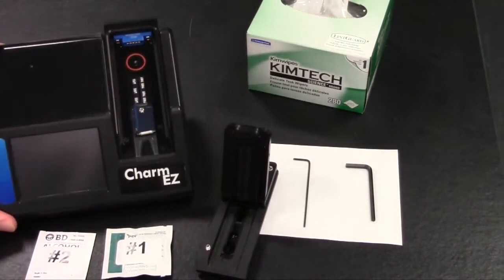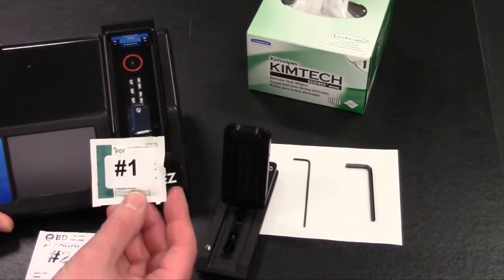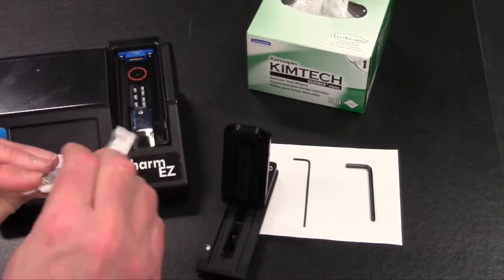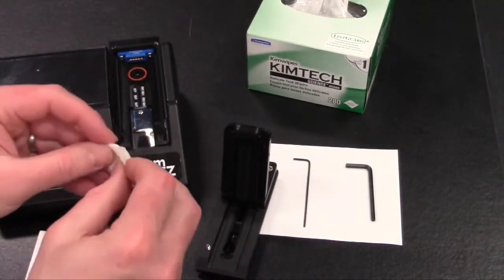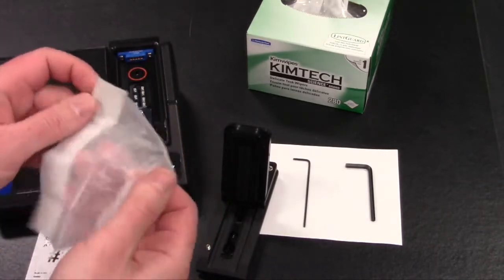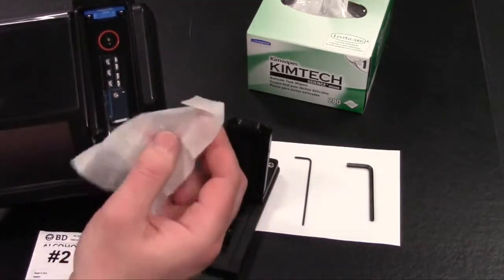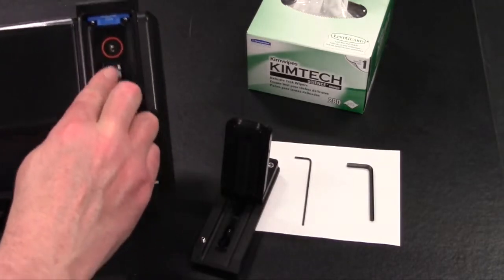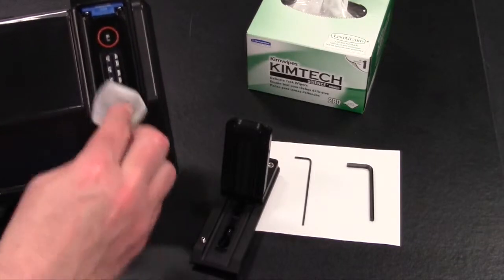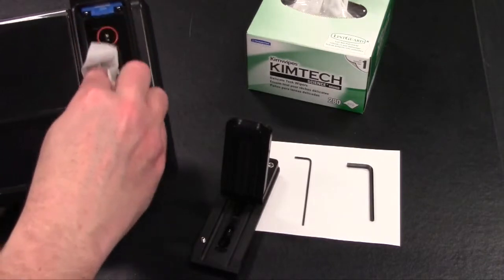To clean the optical area of the Easy Reader, what we will do is first start with the wipe labeled number 1, which is our soap wipe. Tear the packet open and remove the wipe, and then what we can do is use this soap towelette to gently clean the optical area in the Easy Reader. You can use your finger and apply a little pressure just to clean inside and try to remove any dust or debris or any type of dried milk or material that's in this area.